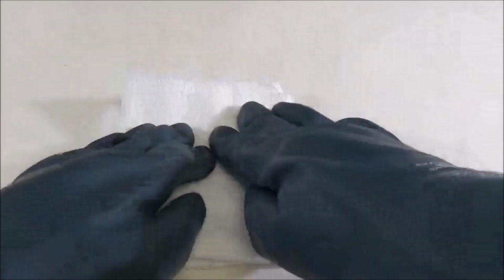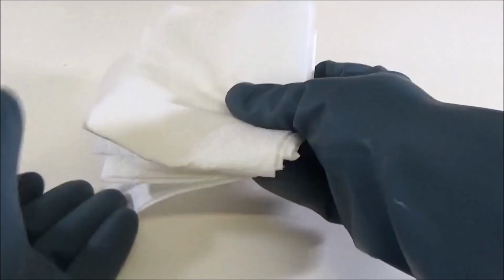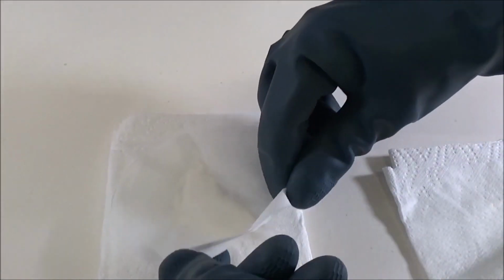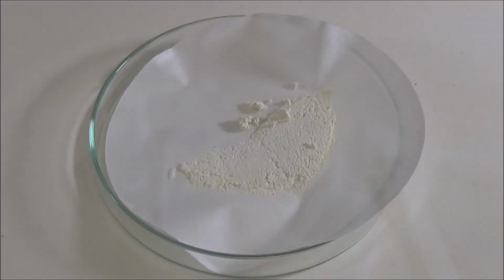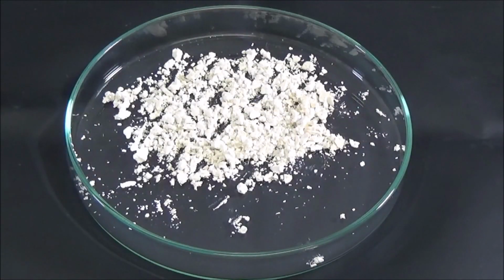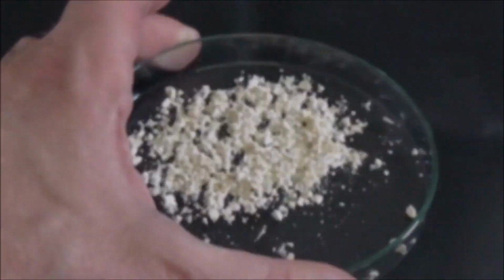The filter paper is then unfolded, the filter cake covered with a second sheet of filter paper and pre-dried between 2 thick layers of paper towels by pressing with fingers and palms. After turning the complete layer, the filter cake is transferred from the first to the second filter paper so that the first sheet can be easily removed from it. We let the mass dry a little on the filter paper so that it can then be transferred more easily and as completely as possible to a petri dish for final drying.